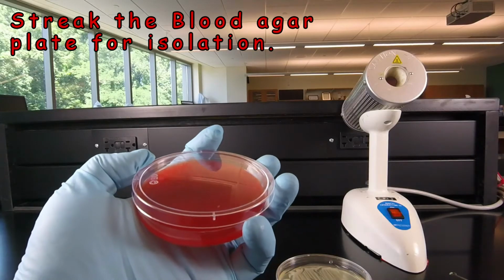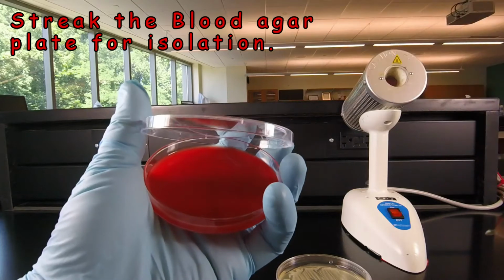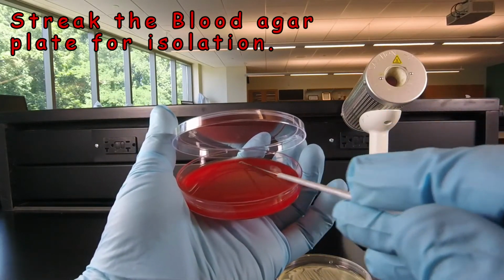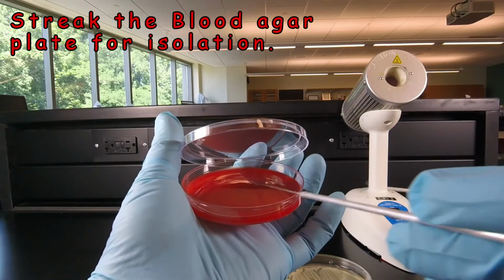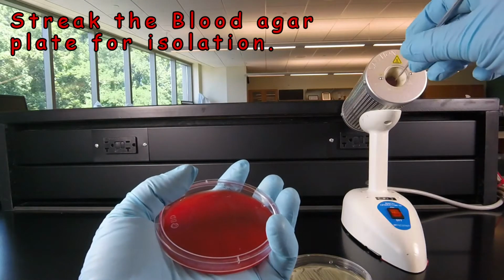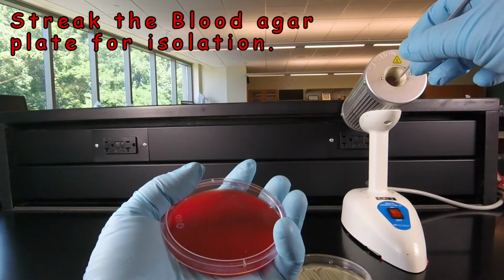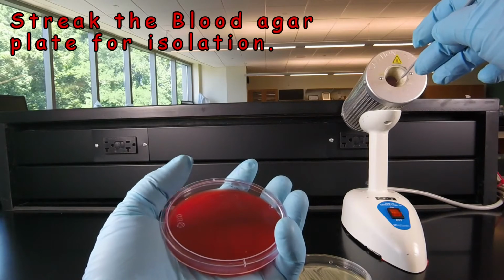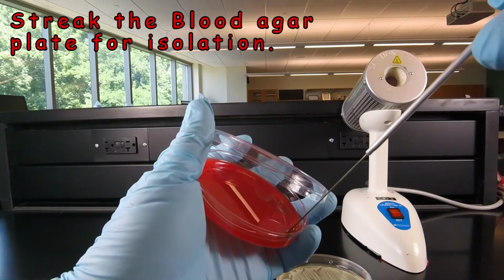So first, as we learned in a previous video lesson, we're going to spread the bacteria over sector 1 on the plate by going back and forth. At that point, we're going to sterilize the loop, kill any bacteria that are on the loop. And we're going to stick the loop in the agar to cool.